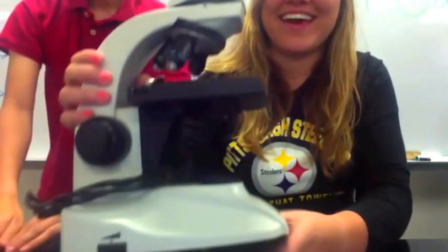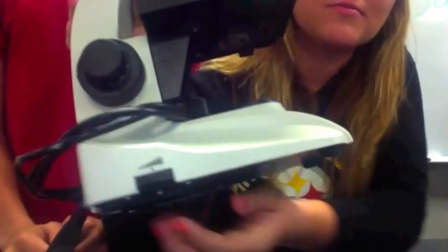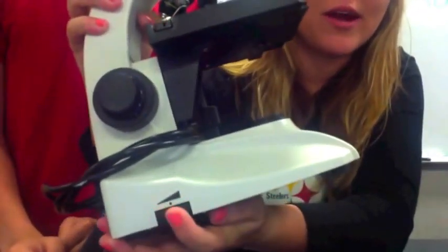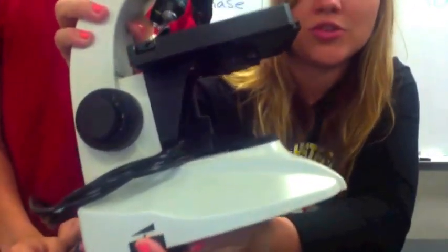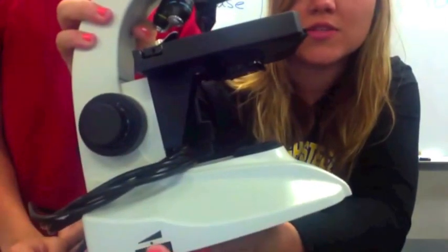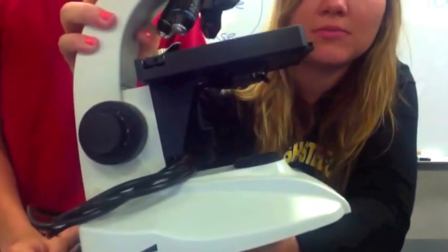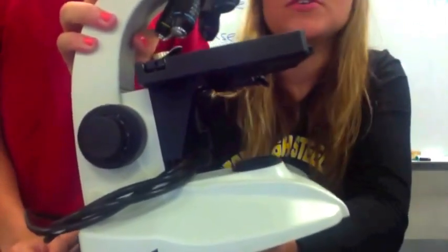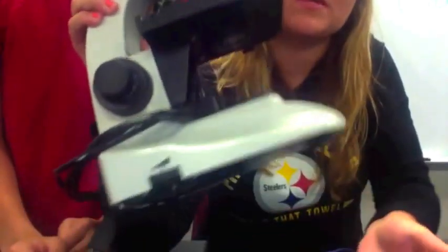This little dial right here is your light control. This is what you would use to dim the light or make it brighter if you want to see your specimen better.